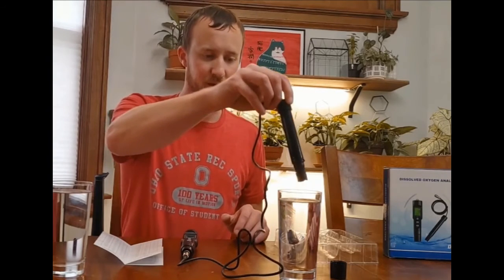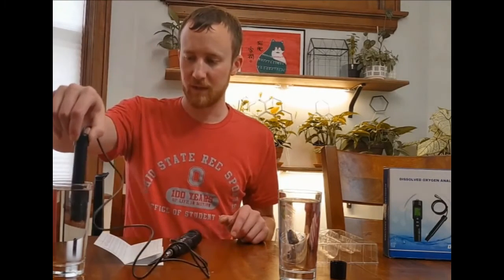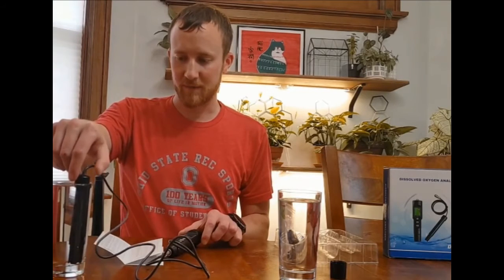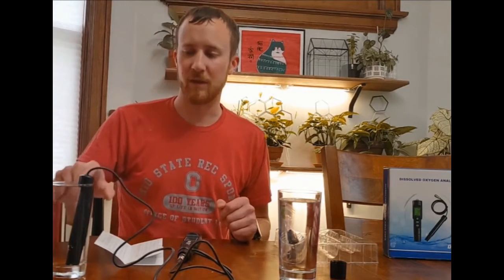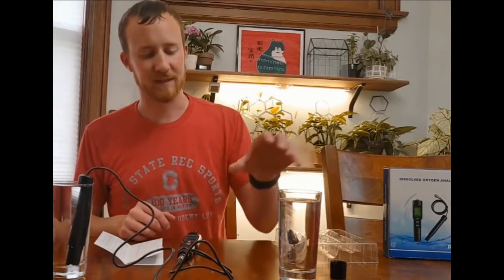This one's at 66.2, which has stabilized, although this is still going down. I'm going to move it over to the other one and see if it's the same temperature here. It's already getting colder. This was tap water. This tap water is colder, so this actually probably has more oxygen in it, and this one has less, which is really what we expected.